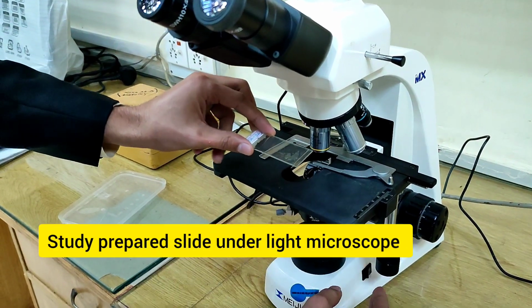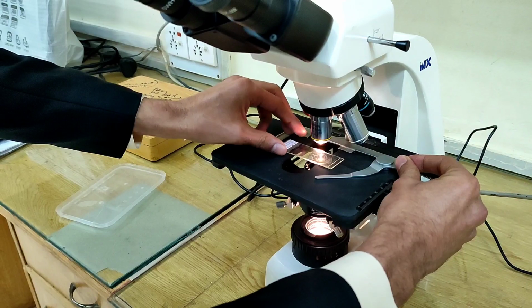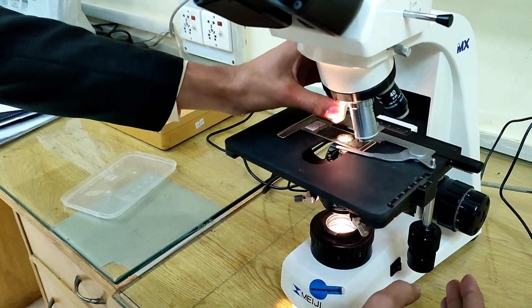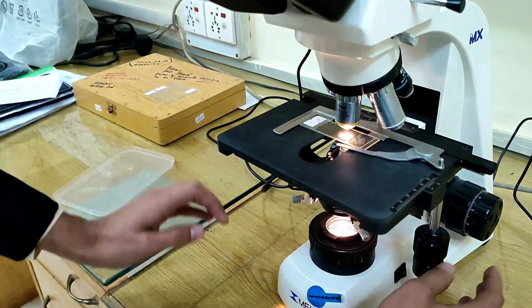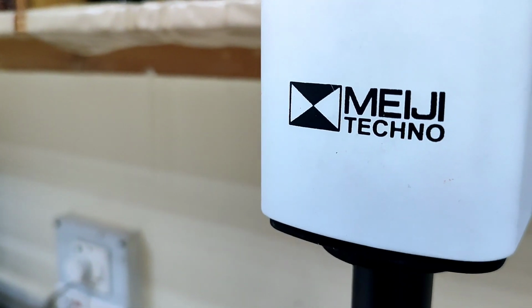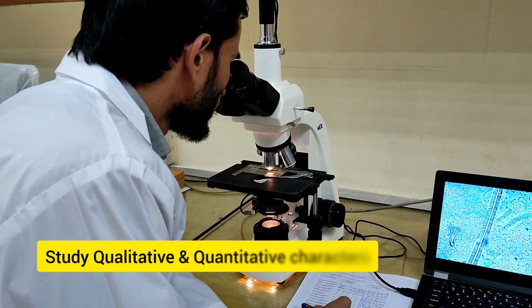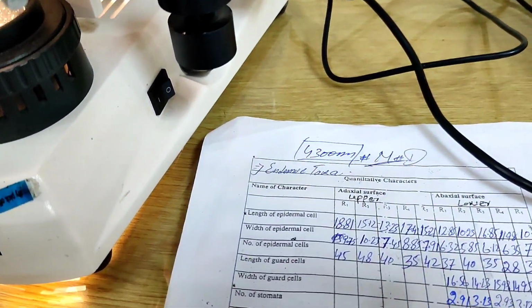Now we are going to study this prepared slide under the light microscope. Here you fix the slide under the light microscope. There are different lenses on this light microscope, which is a Meiji light microscope. Here you see it's a Meiji light microscope, a brand from Japan. The last step to study the prepared slide under the light microscope is to capture the photographs, microphotographs.